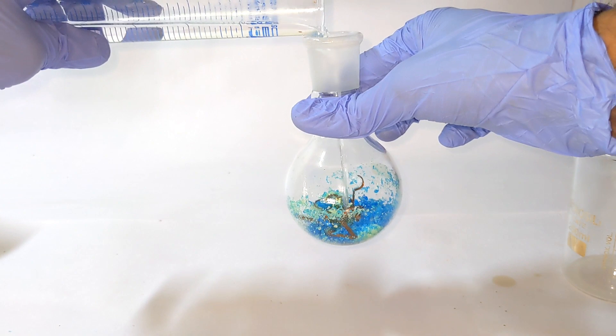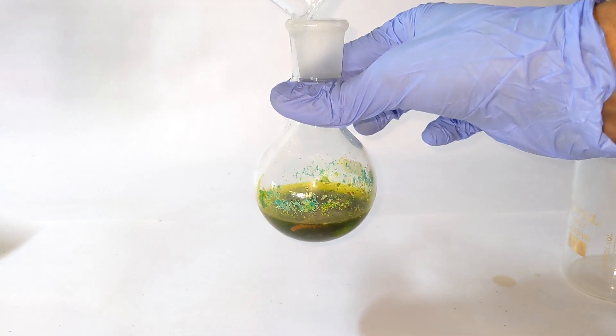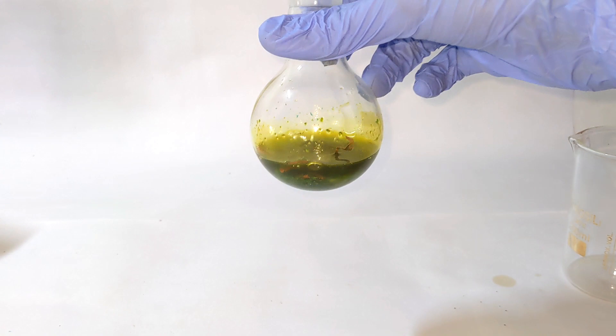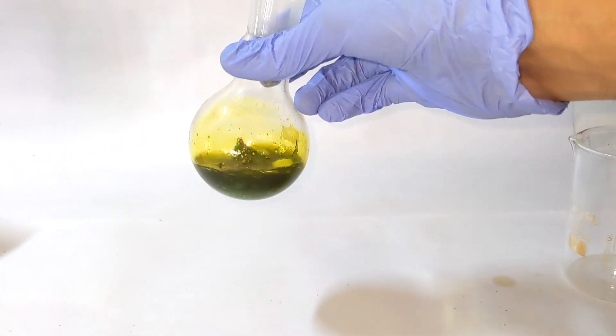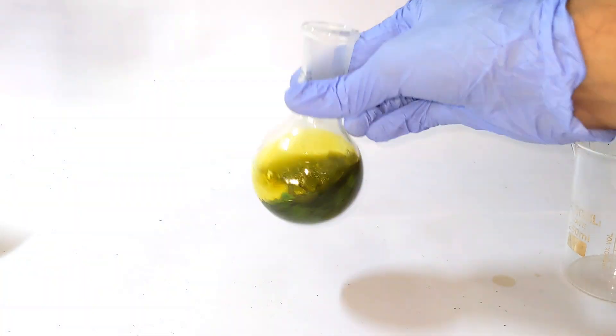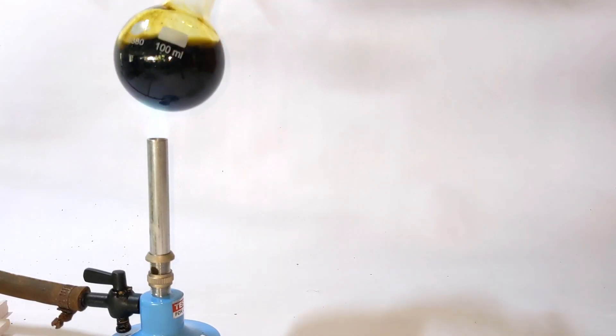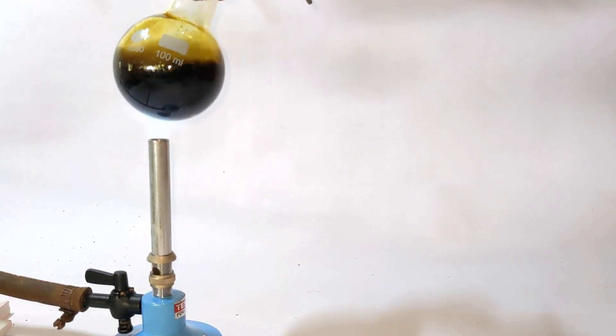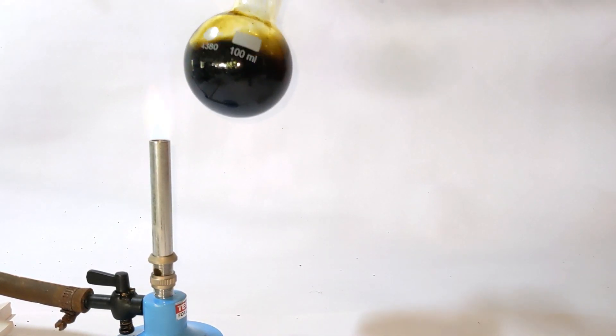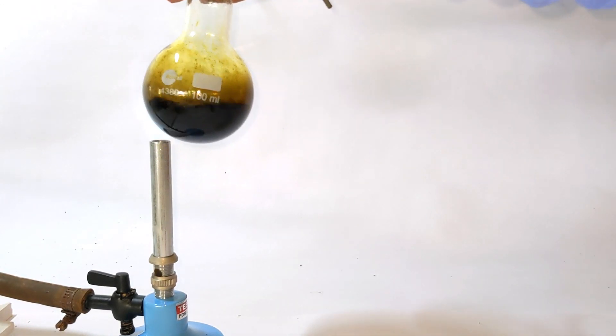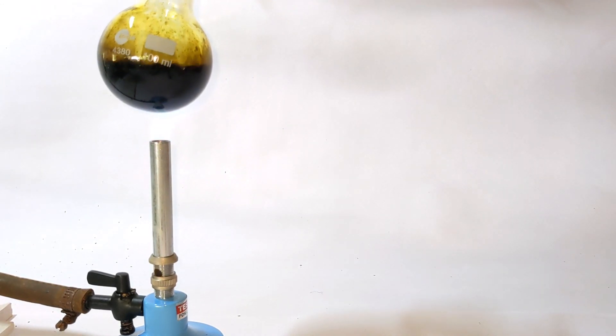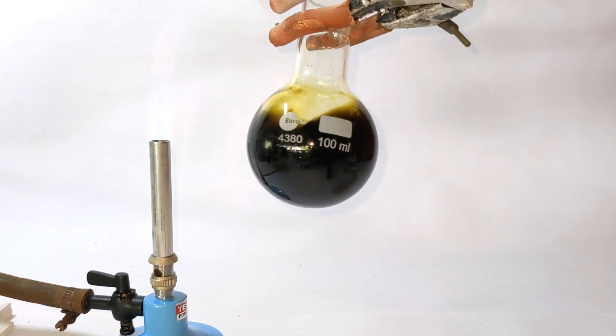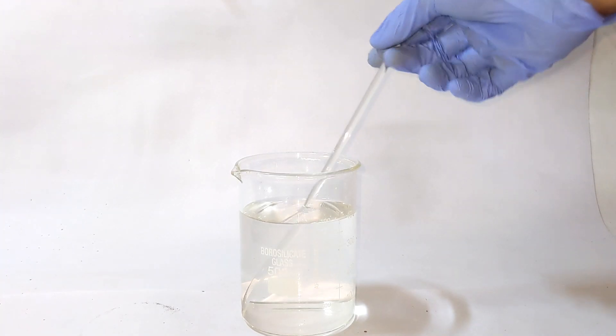After mixing them together, 30 ml of concentrated 36% hydrochloric acid was added and mixed. The contents of the flask was heated until everything seemed to dissolve and the resultant solution was almost dark black in color. It took me about 15 minutes for that.